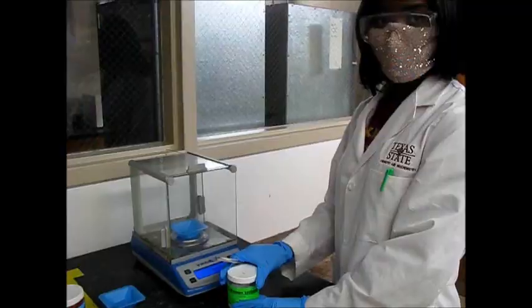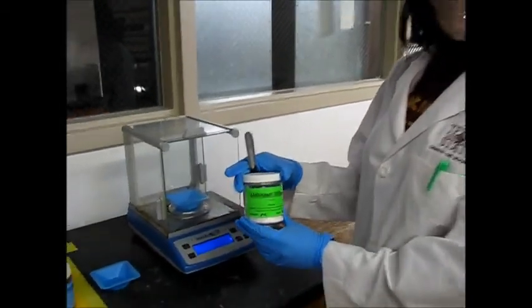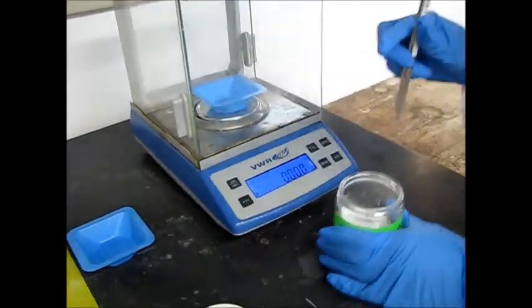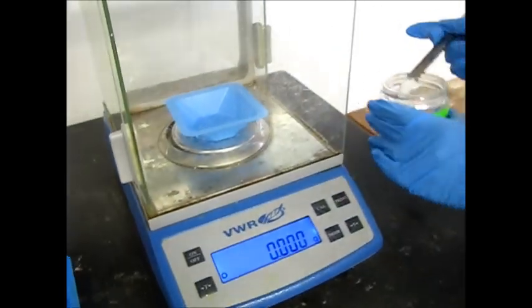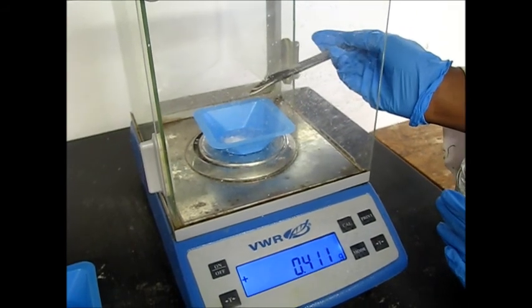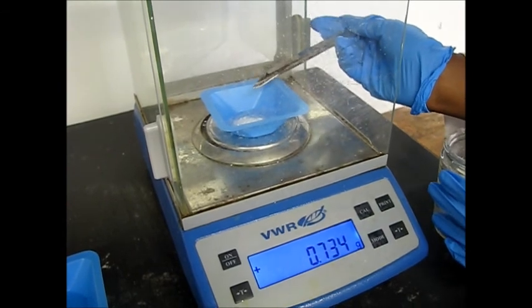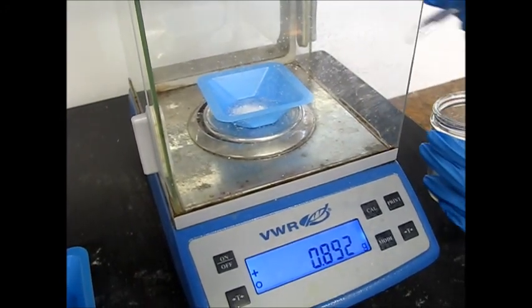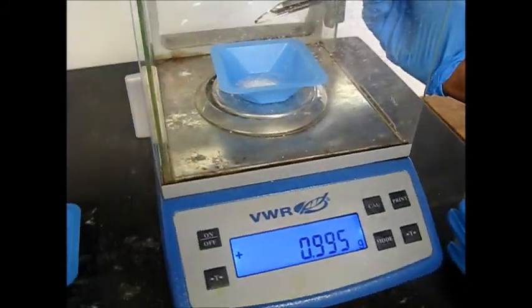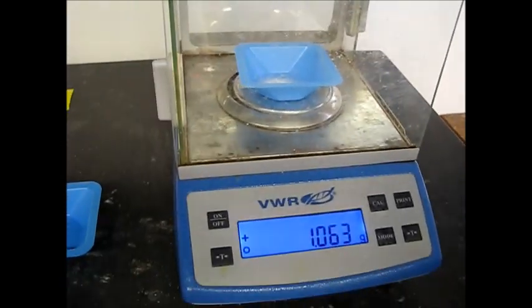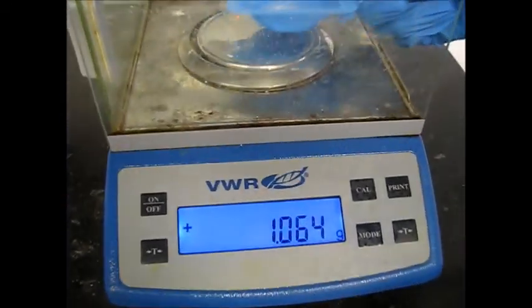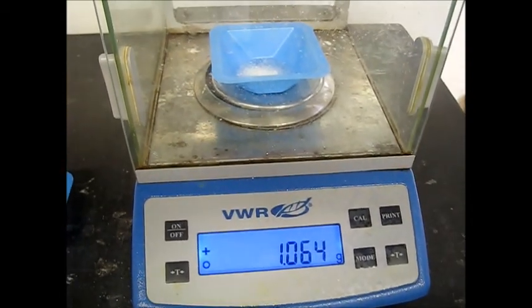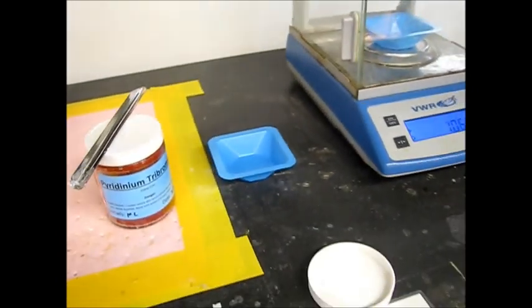So let's set up the reaction now. Now we're going to weigh out our chemicals. So we're going to first start out by weighing the stilbene. We're going to get one gram. I'm going to tare it out. So we have 1.064 grams. Just note that down.